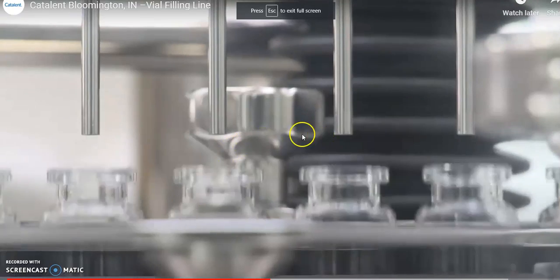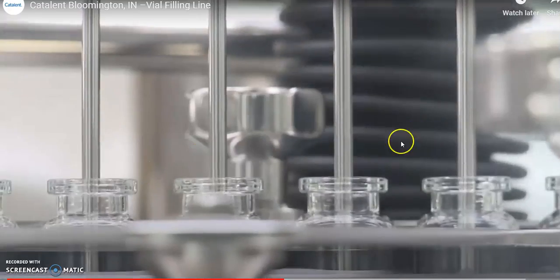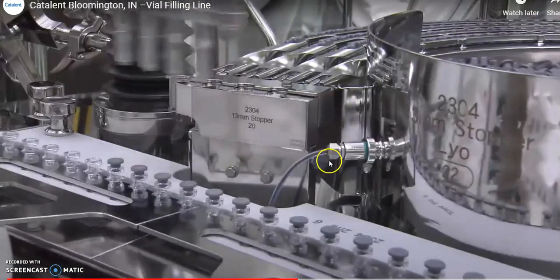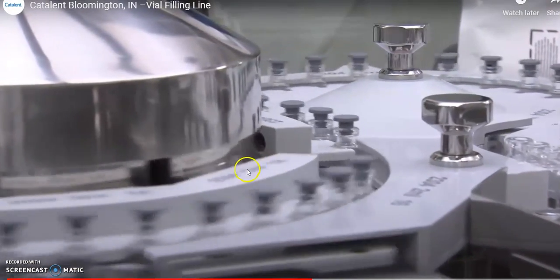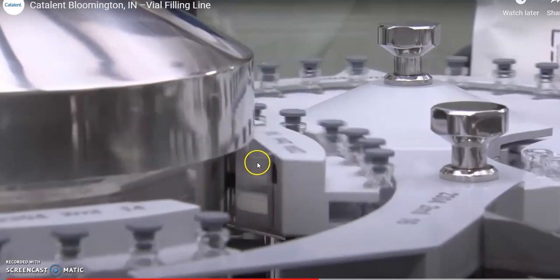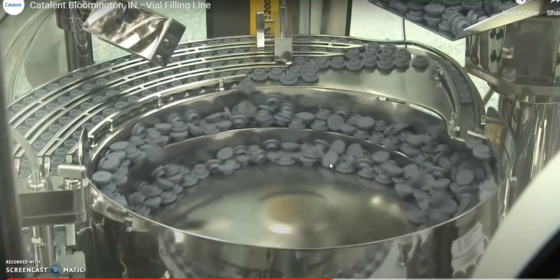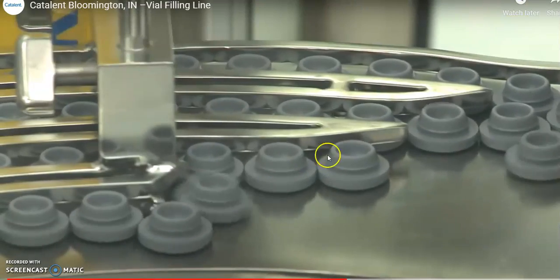So I talked about depyrogenation of your vials. After that, the vials are filled. This is the filling process with the 4 fillers coming down, with the drugs being dropped down in there. And then stoppers are placed on top of your vials. After that, these stoppers are automatically pushed in as well. These are rubber stoppers.